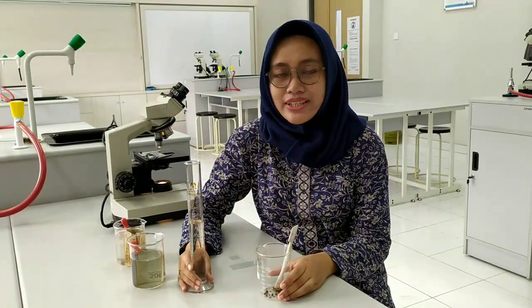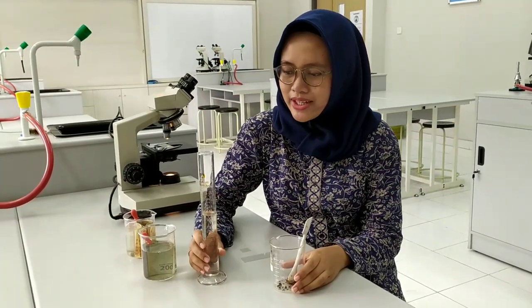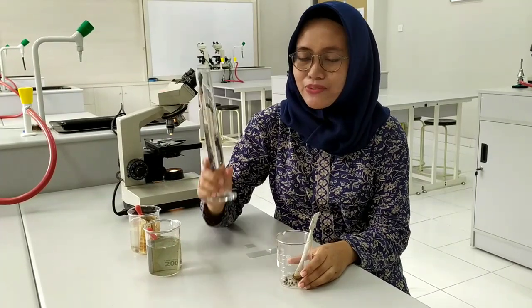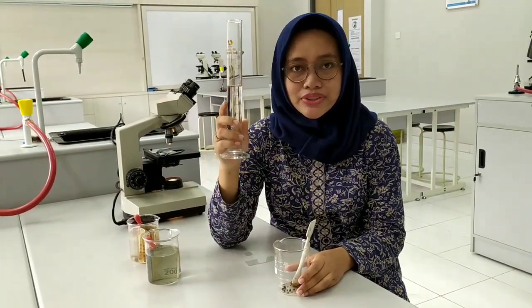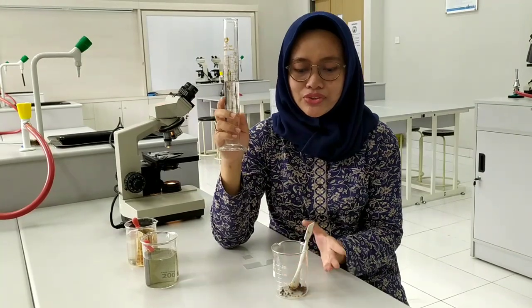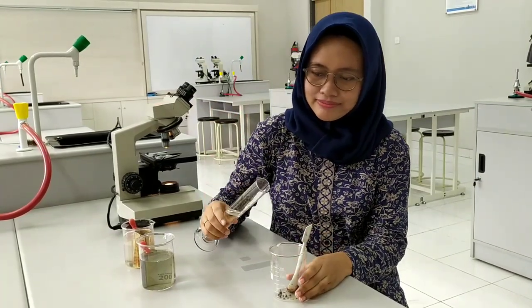Now we already go back to the lab. And we have water here inside the measuring cylinder. We will pour some water into the big glass.